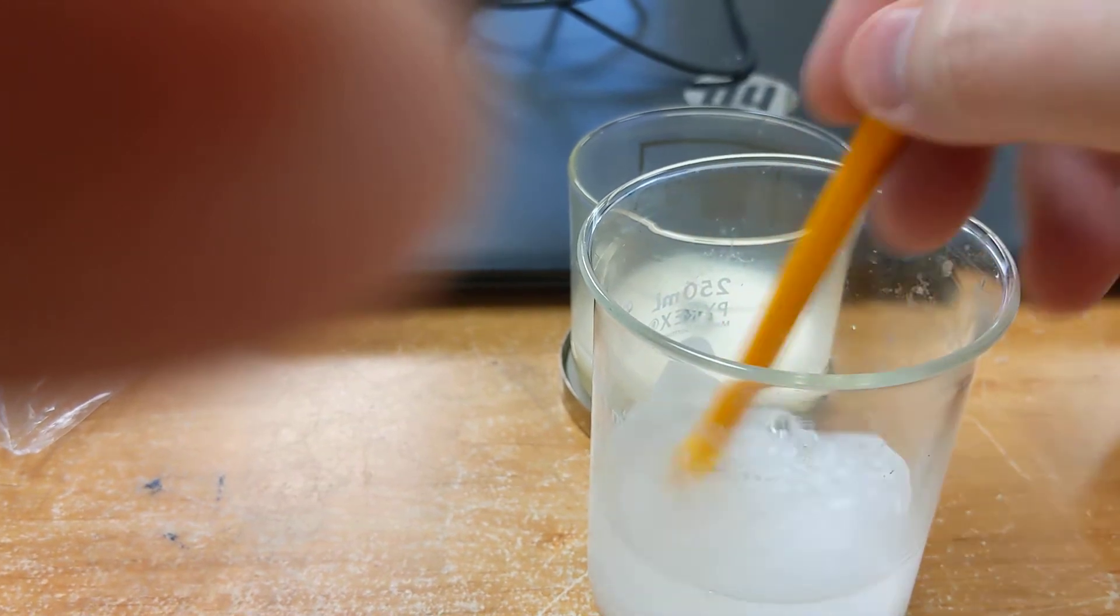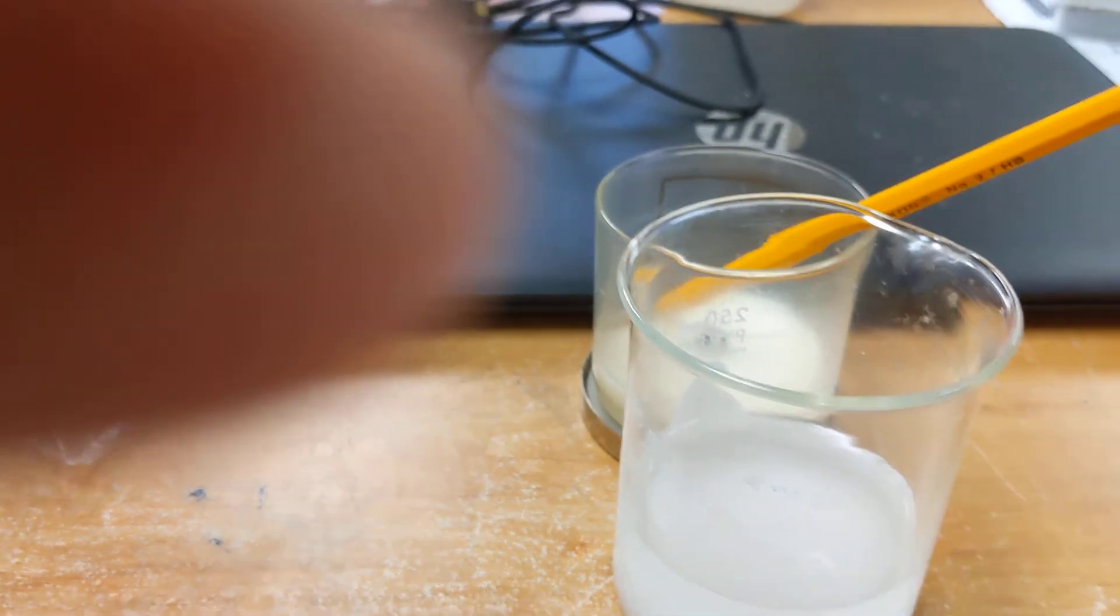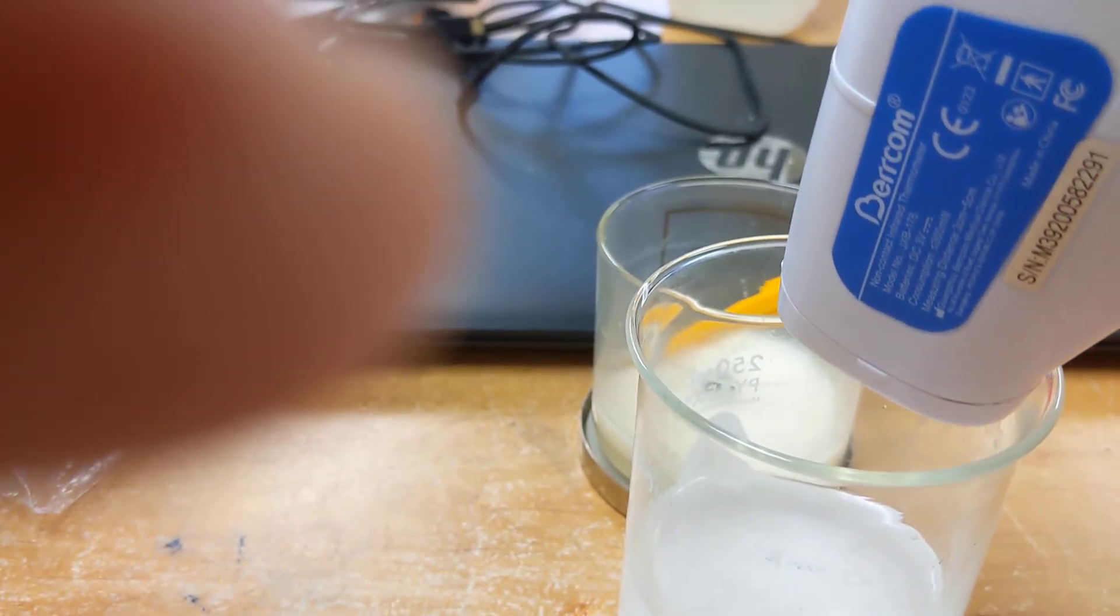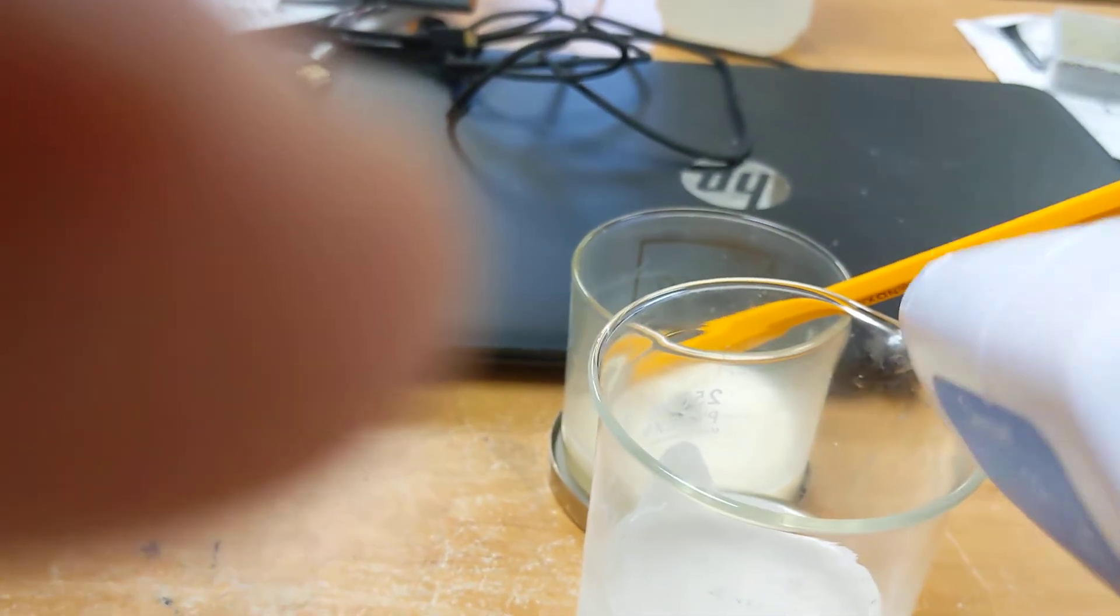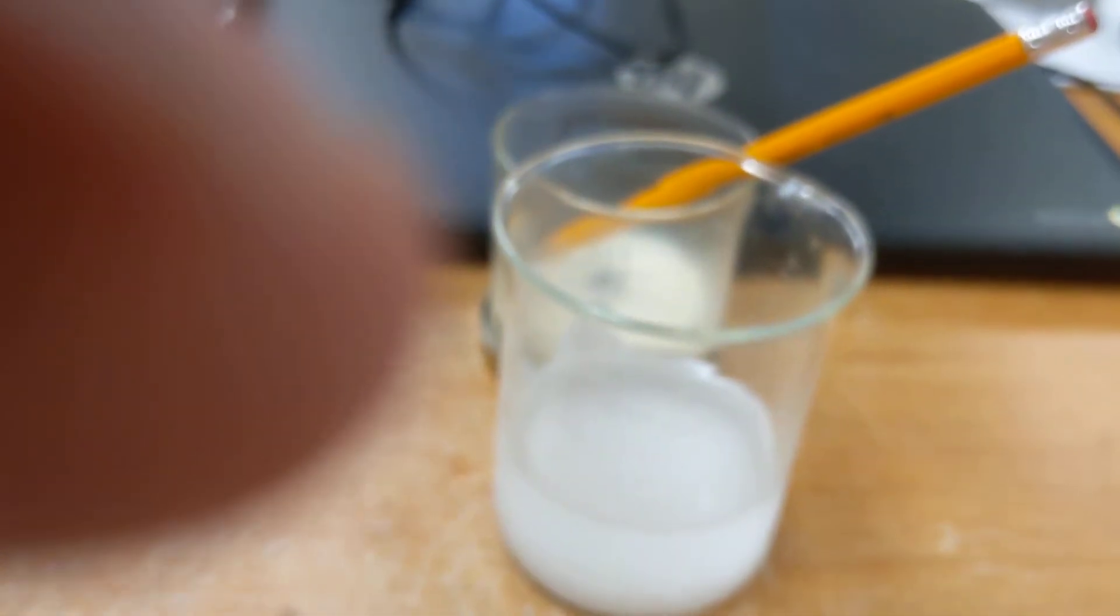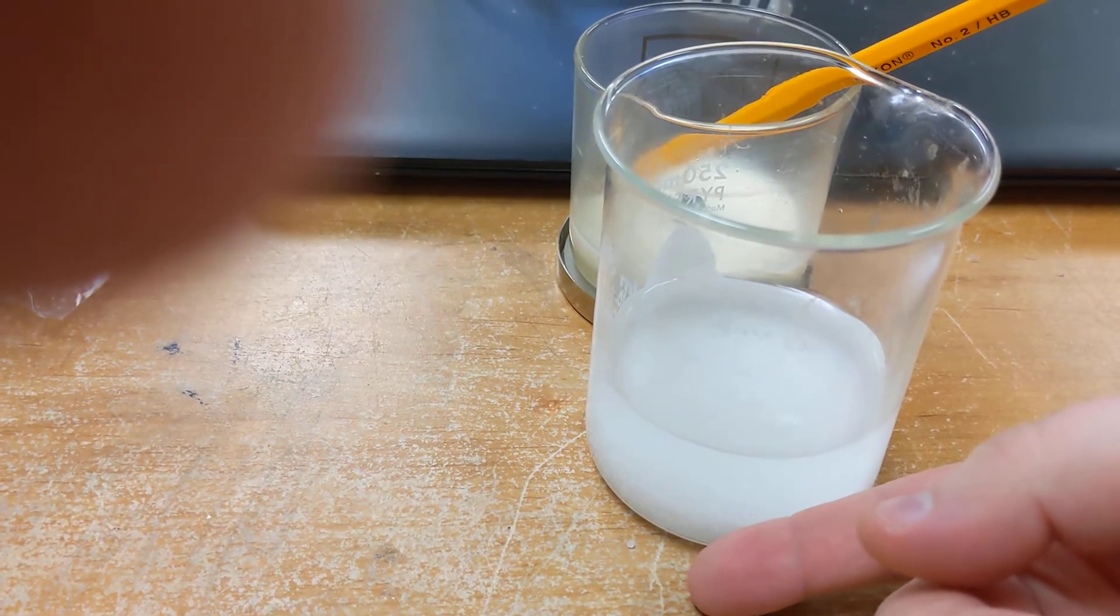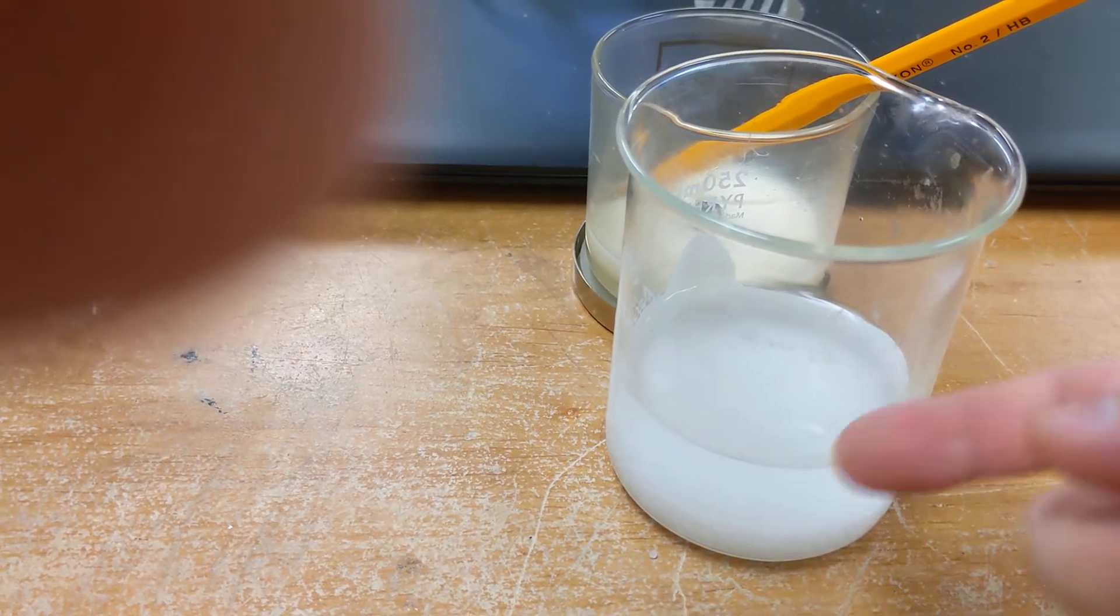All right, that has been mixed. Our current temperature is already down to 44.6 degrees Fahrenheit in just those few seconds. If we touch the side of the glass, it is already feeling like you've got a cold glass of ice water.